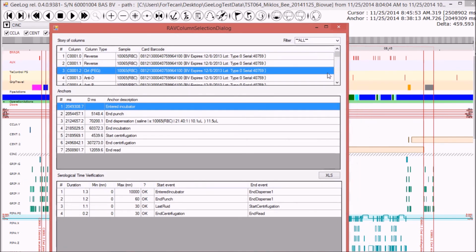The aim of this tool is to make a validation of the analysis, so verify that a number of specific moments called anchors, for instance the dispensation of a volume of reagent or sample into a column, which is one of these little vials that contain reagents, or the fact that one of these consumables has been put into the centrifuge, match the prescribed assay specifications that are included in a specific file.